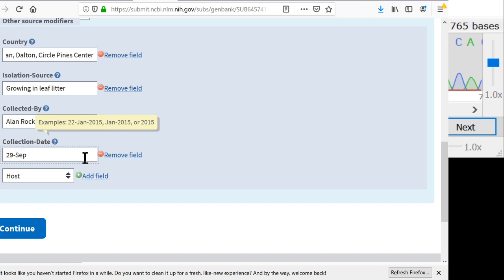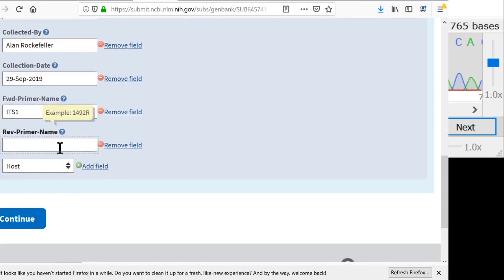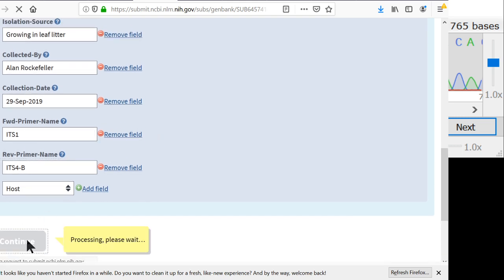So it's real picky about formats. So you got to type 29 SEP 2019. If you type the date in any other format, it'll get mad at you. And now a lot of this stuff gets less important down here. Like we can tell it the forward primer we used. My sequencing forward primer was ITS1. I don't really know why you would need to tell them that, but there's a space for it, so sometimes I fill it out, sometimes I don't. Our reverse primer was ITS4-B, and I think that's enough. So I'll hit continue.